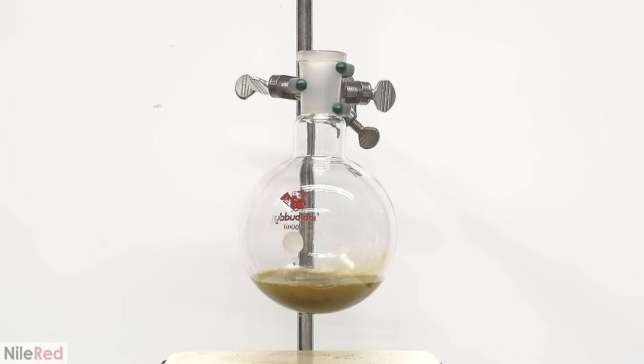The funnel is removed and now it's time to isolate the piperine. To do this, I just need to add some water. Piperine is really insoluble in water, so adding even a small amount greatly reduces its solubility. Every time water is added, we can see a cloud of piperine crashing out. Eventually, when the water is added, it doesn't look like more piperine is crashing out and at this point we're done.